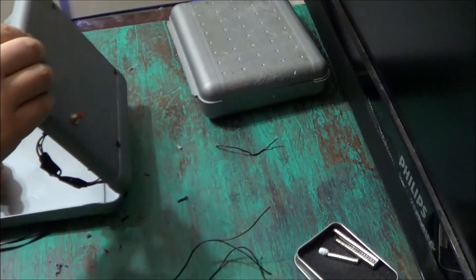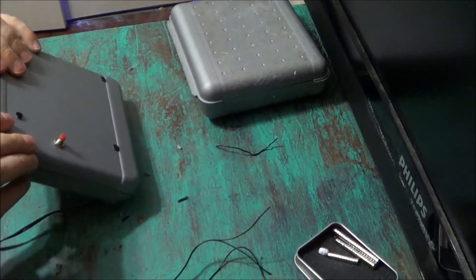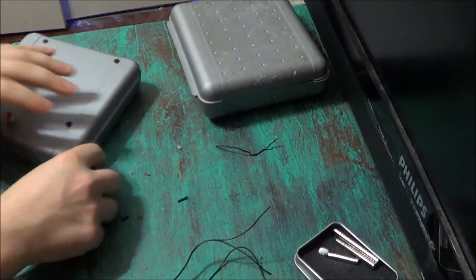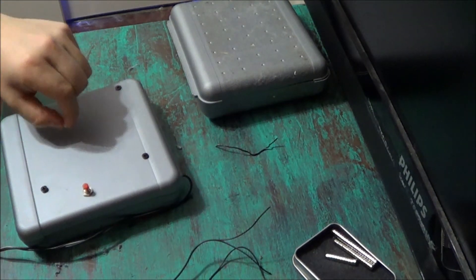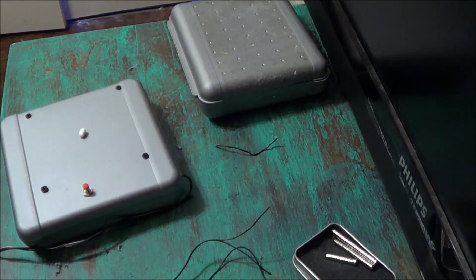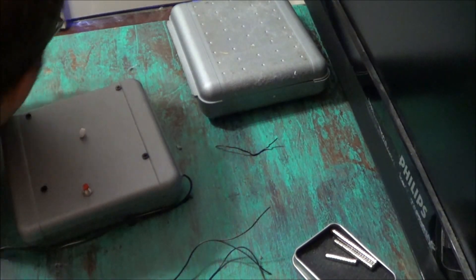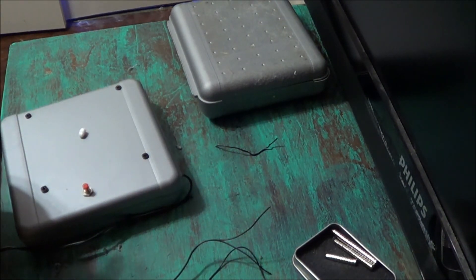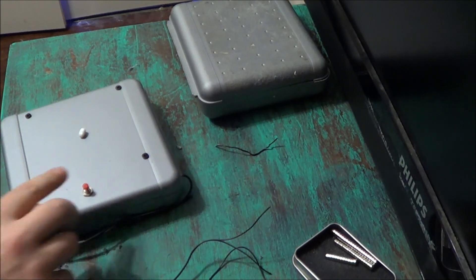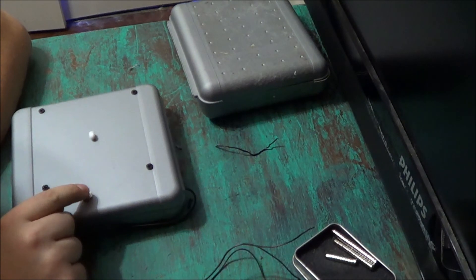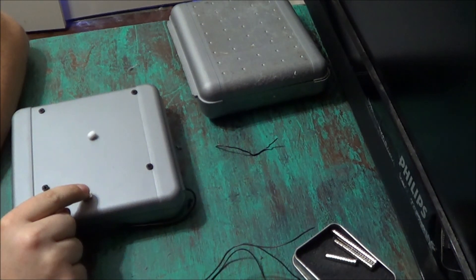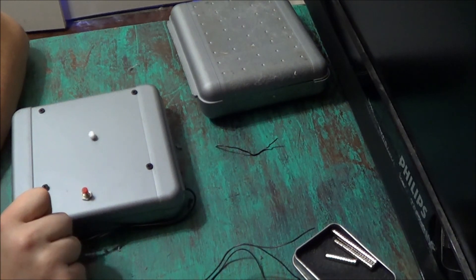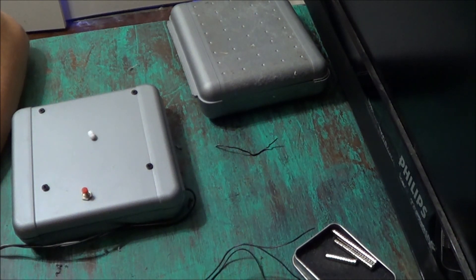So now we're going to close the fan box, we'll take our little magnetic stirrer, we'll put it on top where the magnets are, and we're going to turn our fan on now. So when I hold the button down, it turns my magnetic stirrer on. I let go of the button, the magnet turns off.